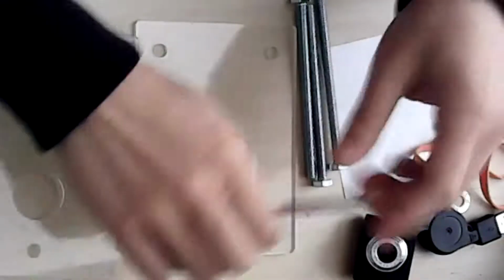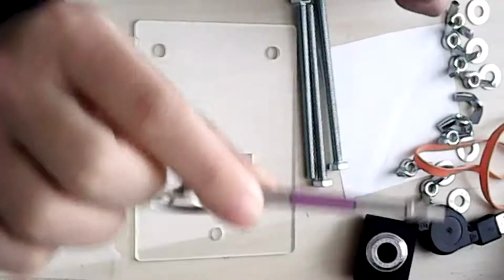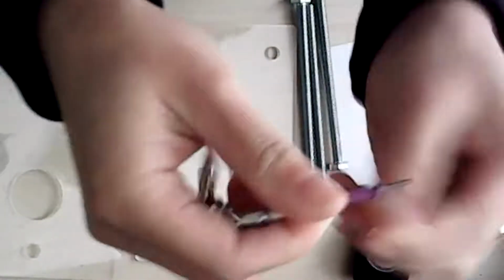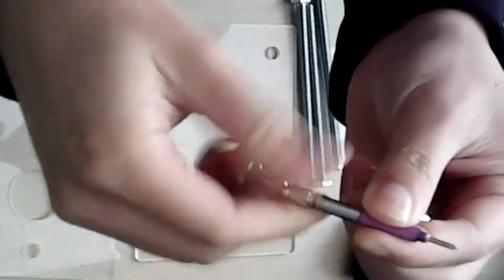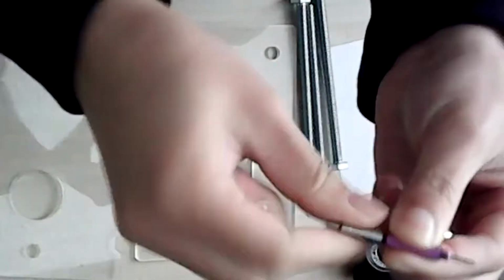Oh, and one thing is that you will also get a small, super cute screwdriver that comes with the kit. All you need to do, it took me a while to figure it out, is unscrew it, and then it will have 2 sides. Unscrew it properly. And so you have 2 sides, depending on which side you need.